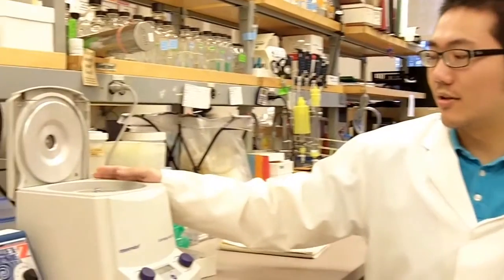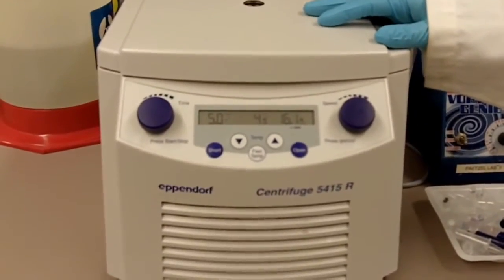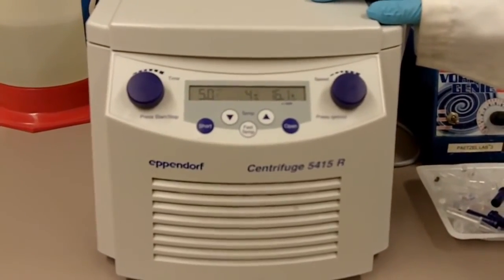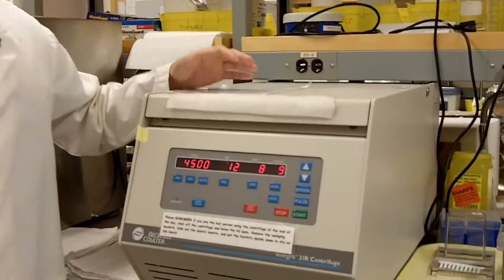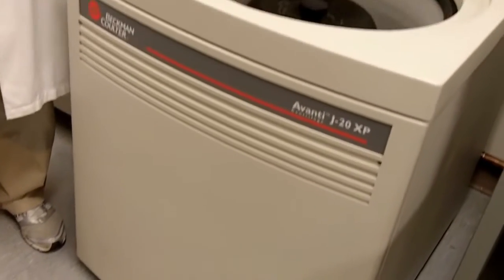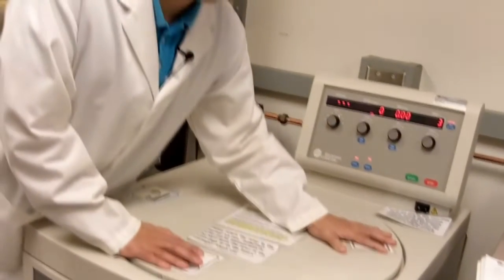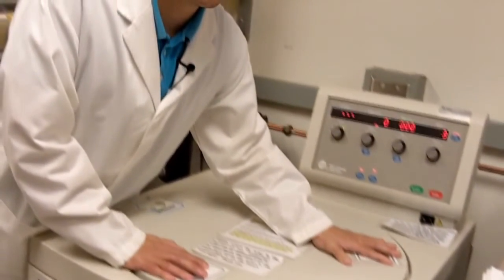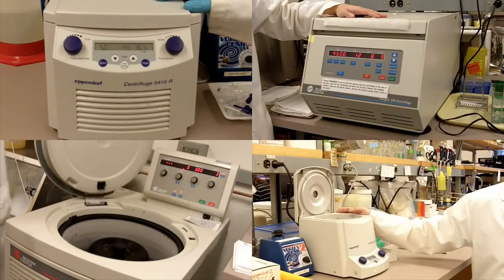This is a standard tabletop centrifuge. Here is a temperature-controlled tabletop centrifuge. So this is a bigger centrifuge for bigger tubes. This is not a washing machine, it's actually a high-speed centrifuge. You don't want to mess with it. No matter which centrifuge you use, there are a few things you need to remember.